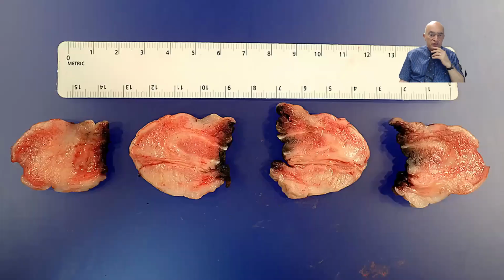This is a partial penectomy just of the glans penis, also with the presence of some tumor, in the background of the erectile tissue that is more pink and kind of spongy. You can see that the tumor is represented by these areas of more uniform appearance.